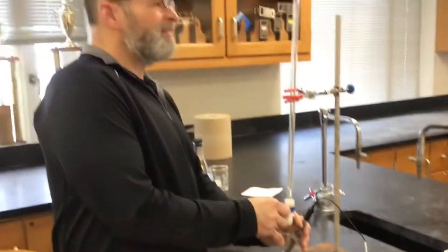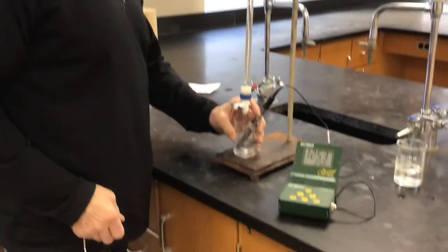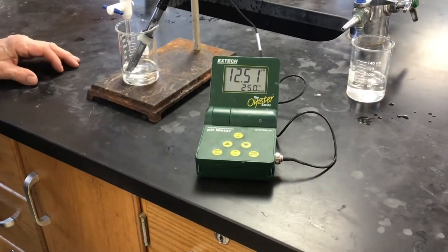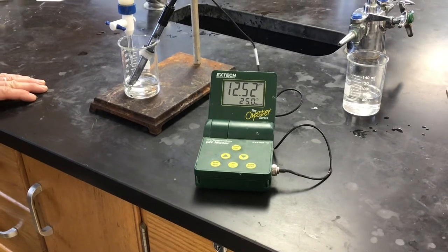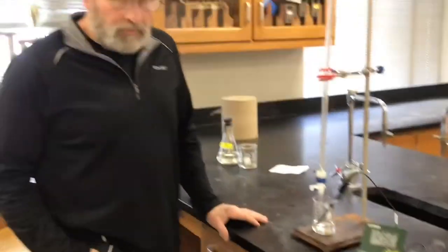Even 12 milliliters added? Yep. I think one more will take care of it for us. There's 12. Sample four — we're trying to find the concentration of that strong acid.